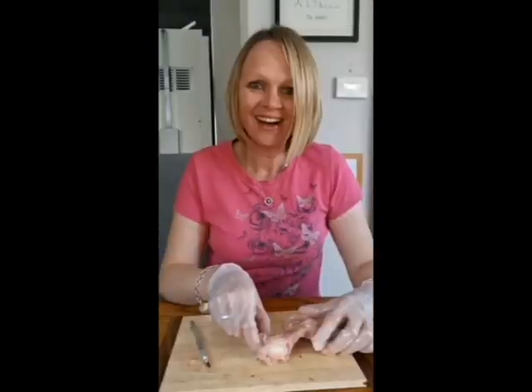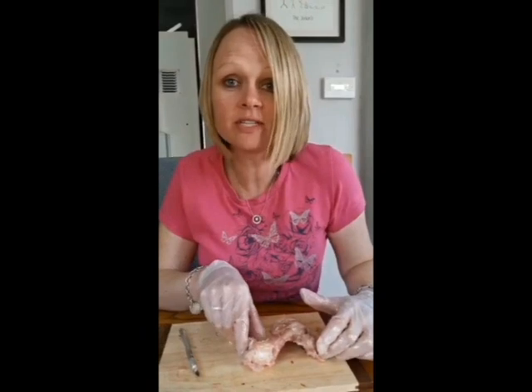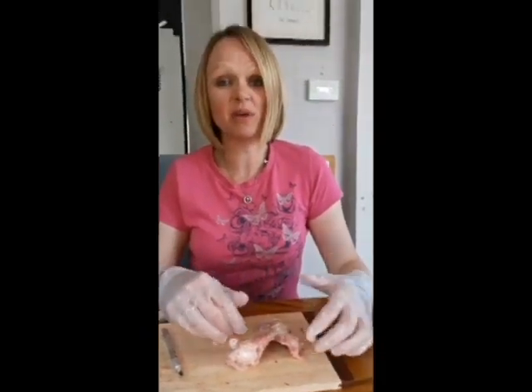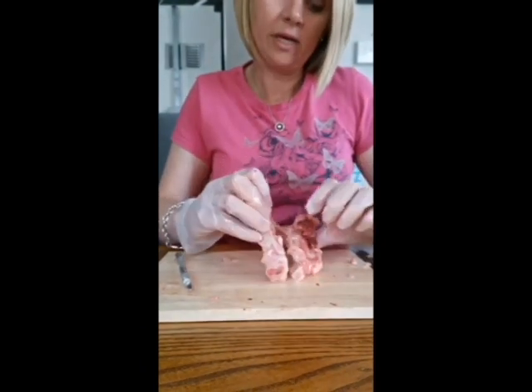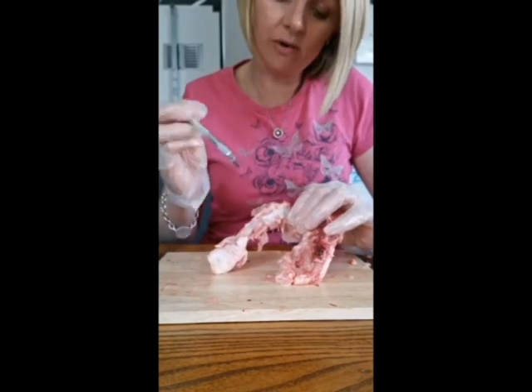Okay? Alright, so I'm down there. So what I'm going to do is show you the ligament that I've just exposed. As I flip it, it will be a little bit gruesome because this bit looks a little bit dirty. There's blood clots and things like that on the bone. So just to warn you really quickly. So there we go. Right, can I just have a close-up on this bit here?